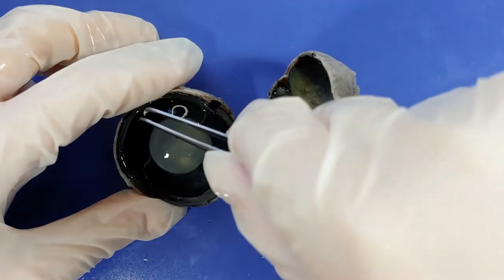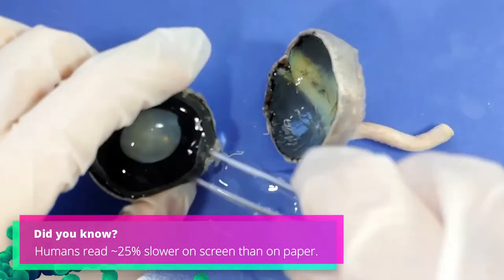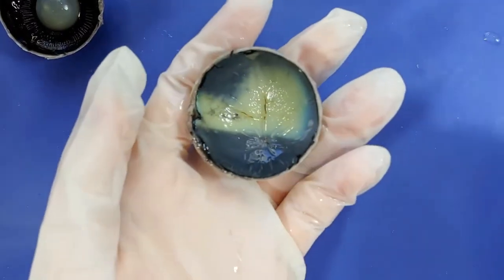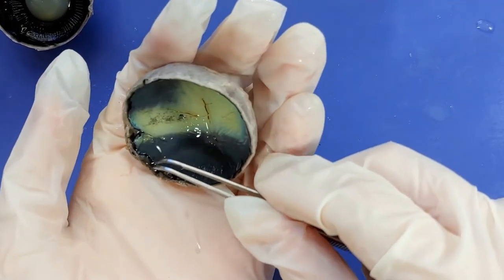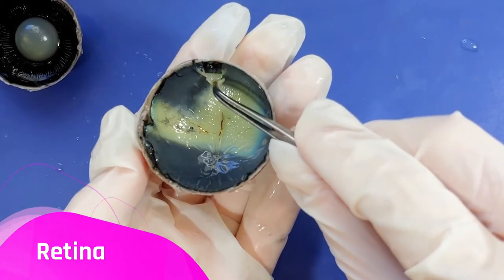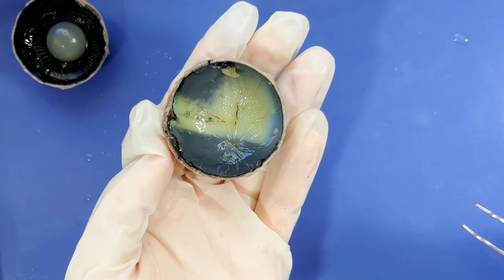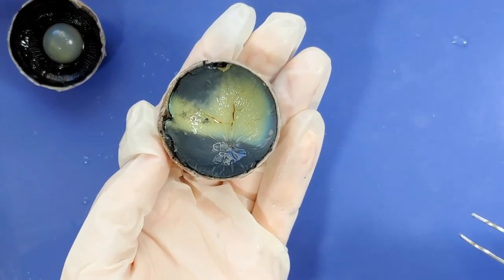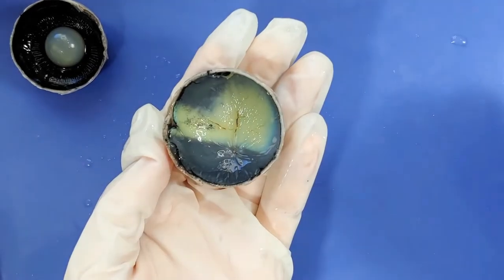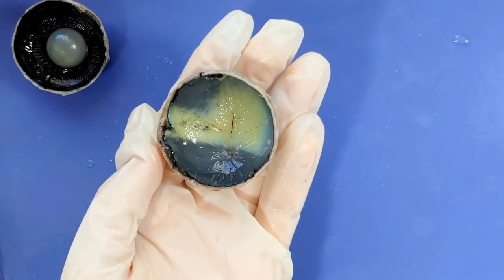Now I'm just going to remove the vitreous humor. Now let's look at the posterior part of the eye. This beige layer right here is called the retina, and the retina is the most important part of the eye because it converts visual information into nerve impulses. Imagine a TV screen — each image you see on the screen is made of thousands of tiny specks of light. The retina works just like that, but reversed. When an image is projected onto the retina, each tiny speck of light gets converted into a nerve signal by light-sensing cells called rods and cones. Then all those signals get sent to the brain through the optic nerve.